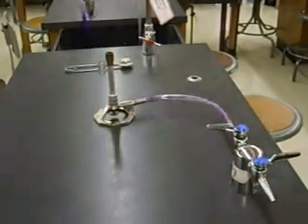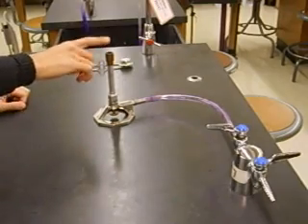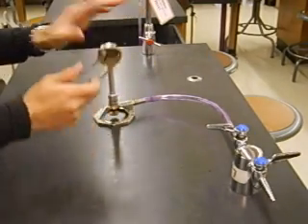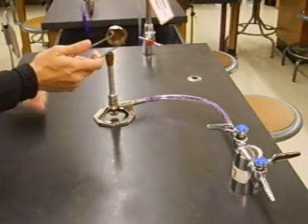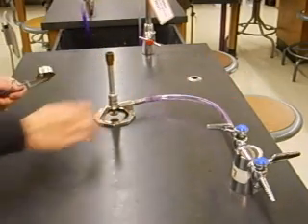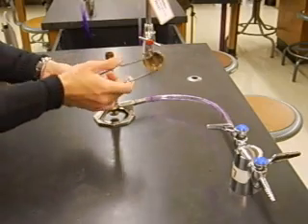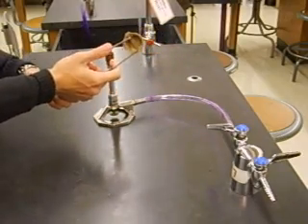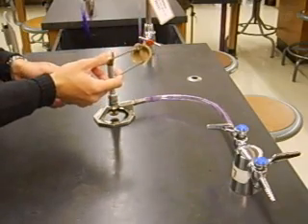Here's some more things you need to know. Before you actually light your Bunsen burner, it's probably a good idea to practice with the striker to see if you can get any sparks to fly out of this thing. Even before you turn the gas on, practice manipulating the striker so that you can get some sparks to fly out of it.